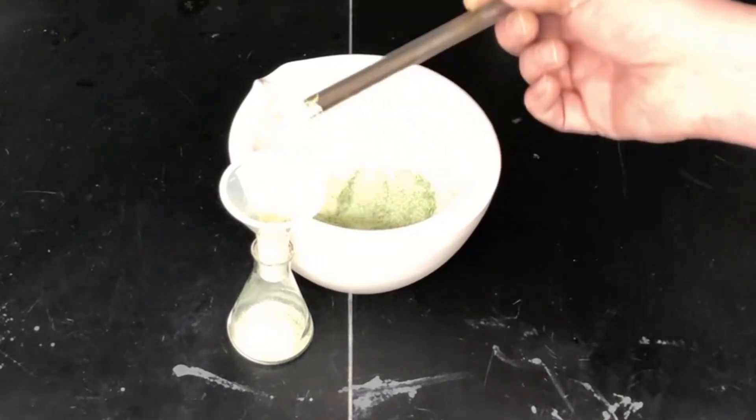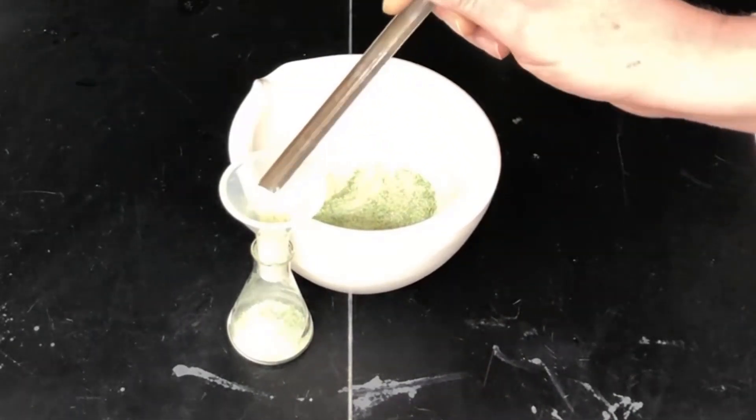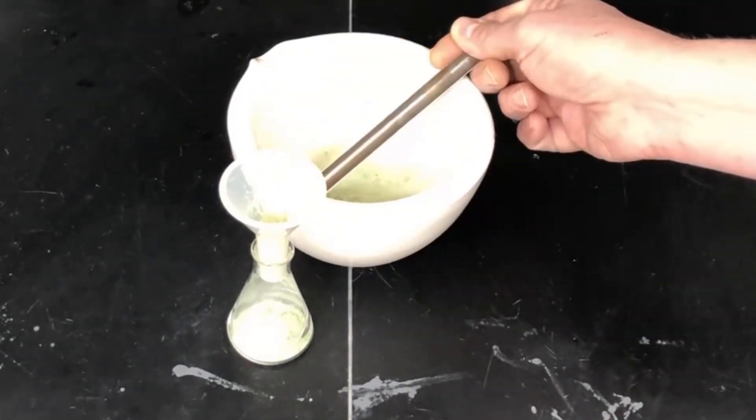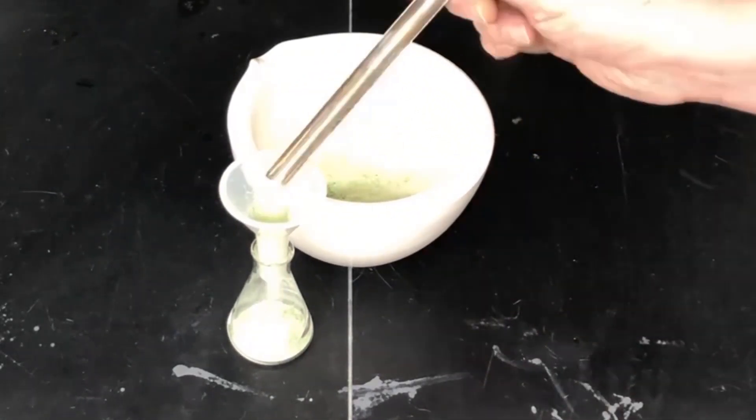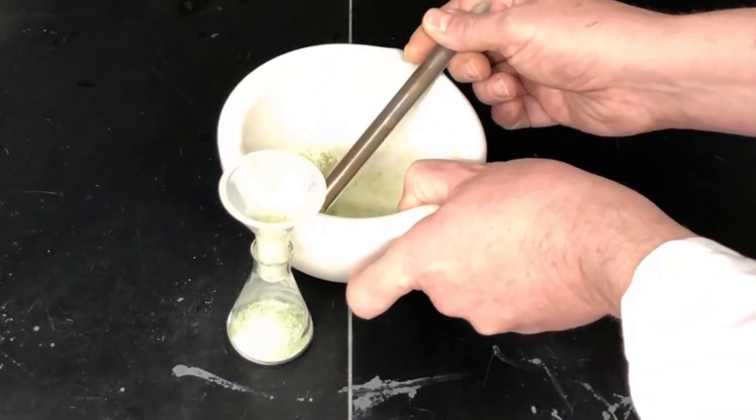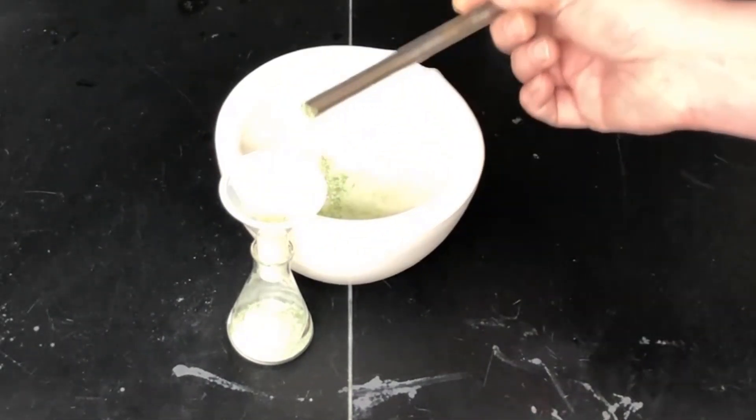And then as we get down, I'll end up pouring the rest of it in a little bit later on. It can be kind of challenging to get this material in if you try to do it all at once a little faster.